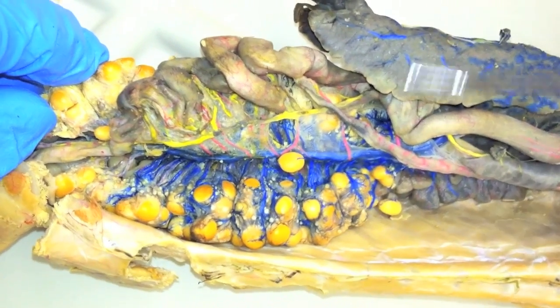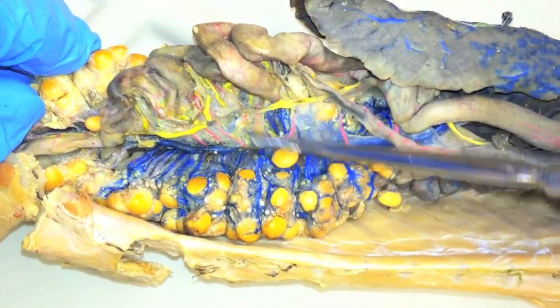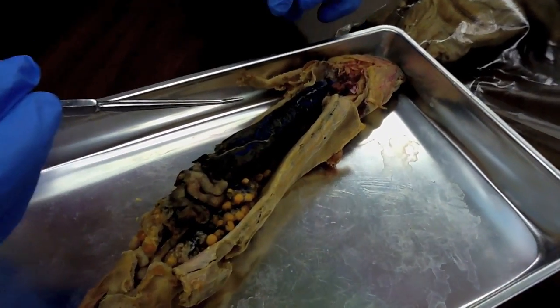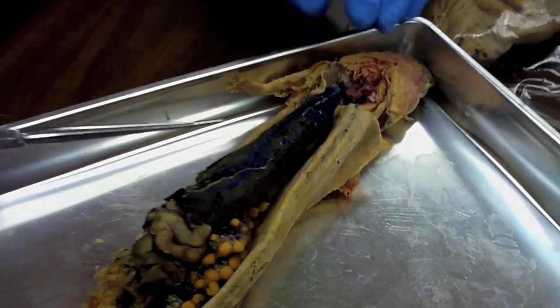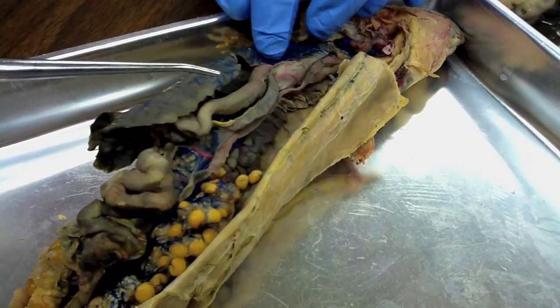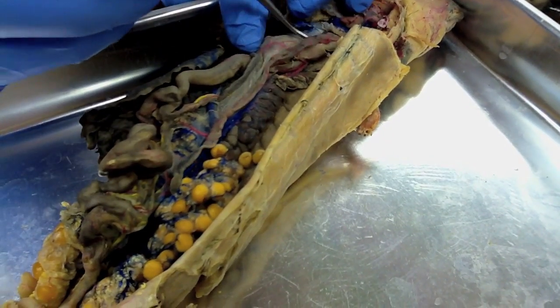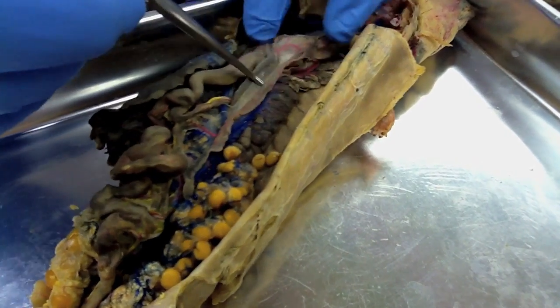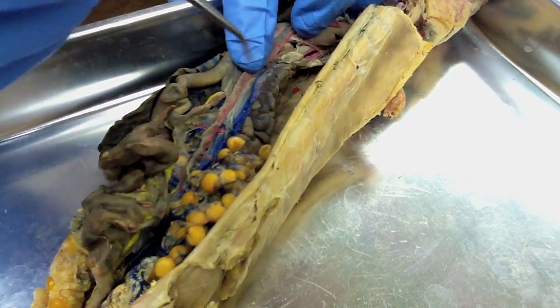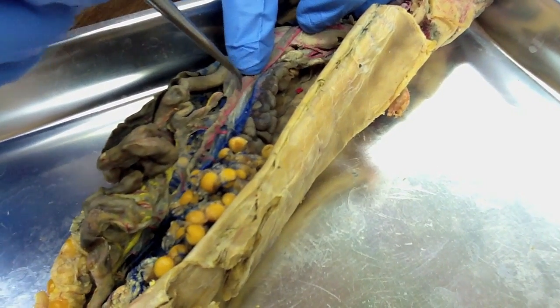The mesenteric arteries are on the mesentery. On the lung of the mud puppy is the pulmonary artery — right down there in pink, that's the pulmonary artery.